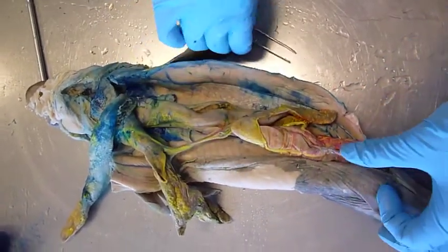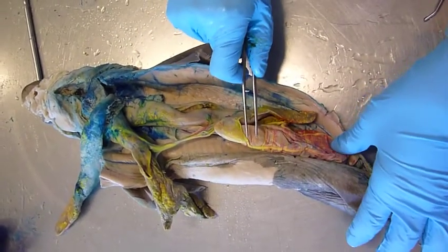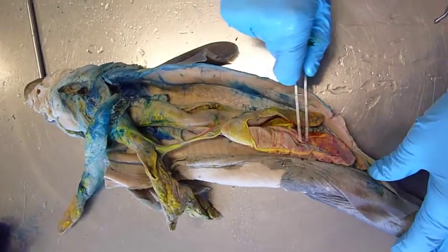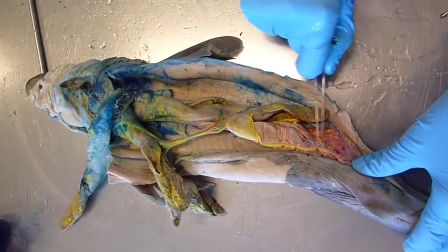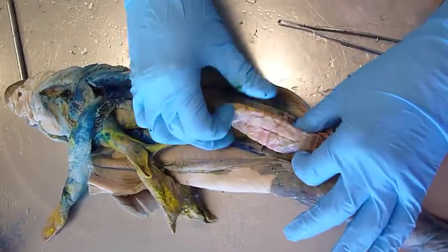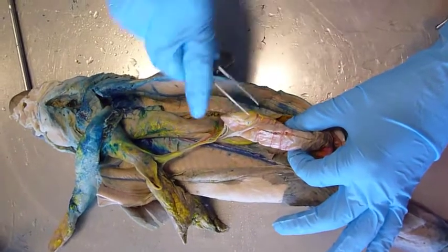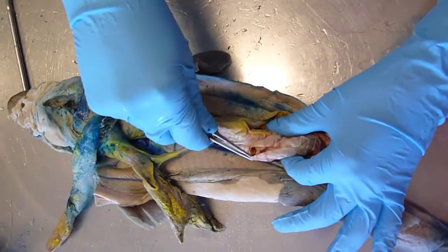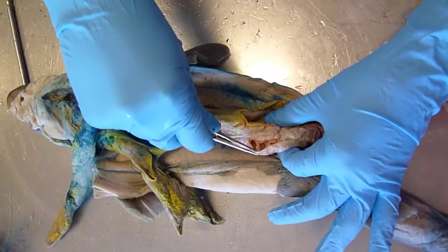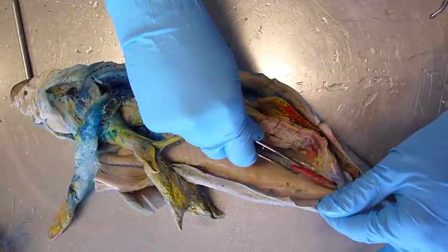Here we have the intestine. The upper part of the intestine is called the duodenum. The lower part of the intestine is called the colon. Inside the intestine we have spiral valves, which can be seen here. And here we have the rectal gland.